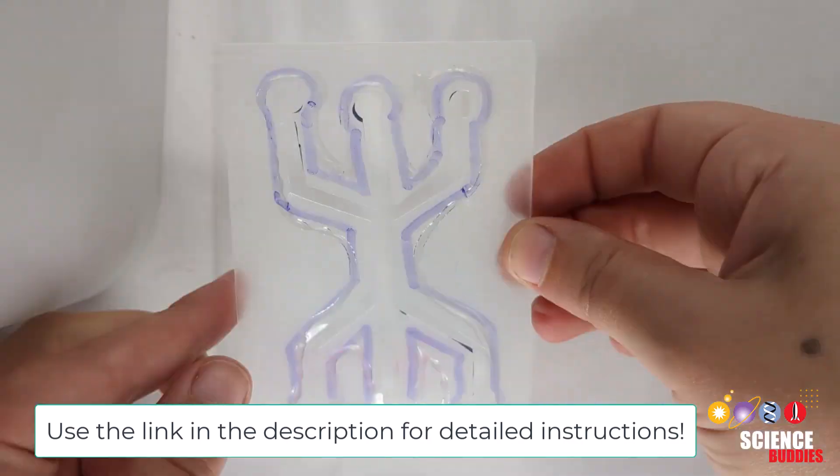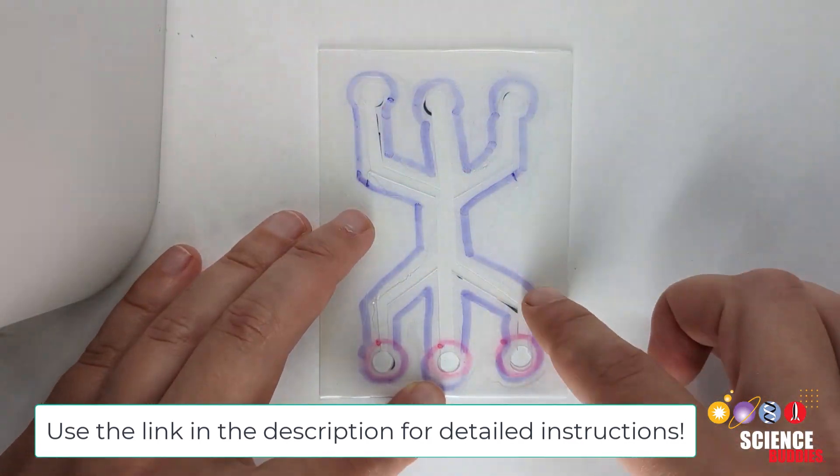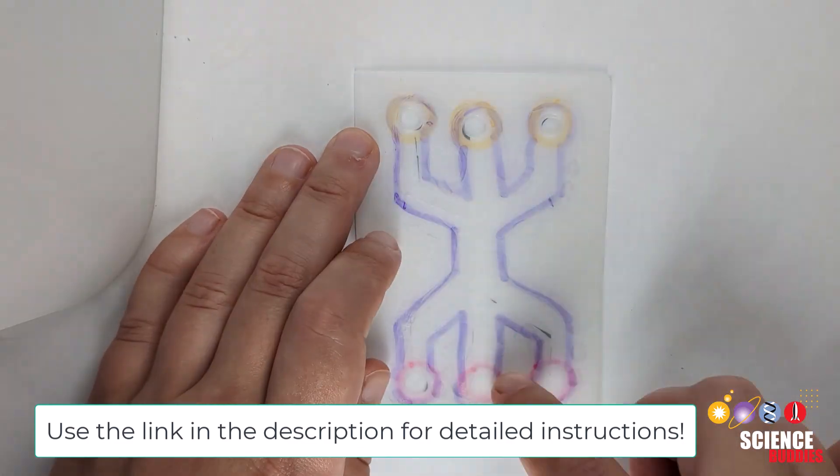Finally, glue around the channels and the edges of the middle sheets to make sure the polymers cross-link or fuse together during the shrinking process.